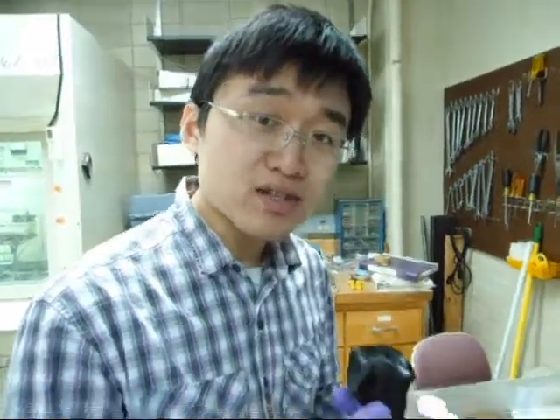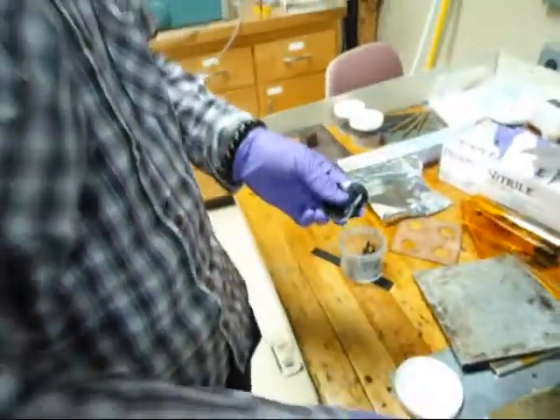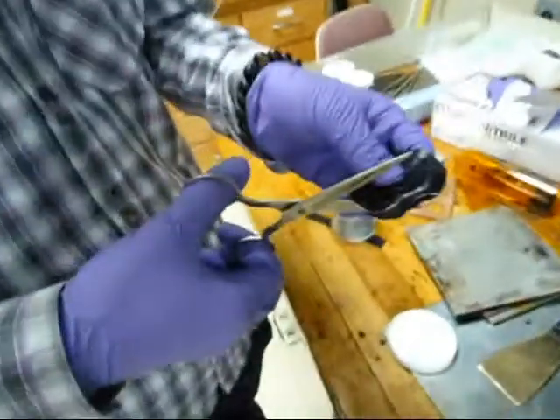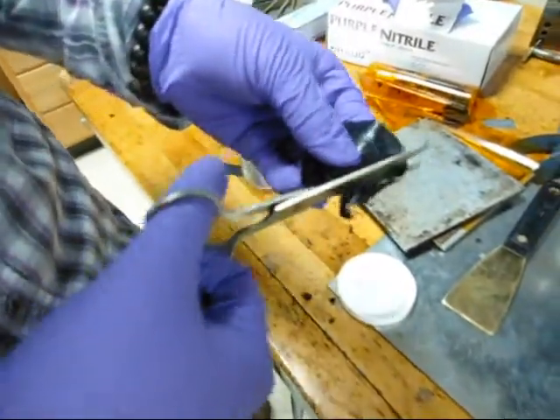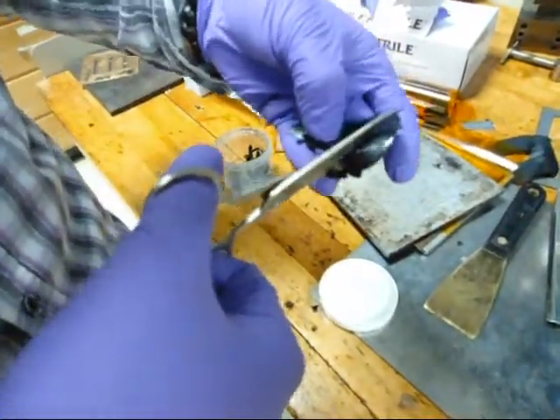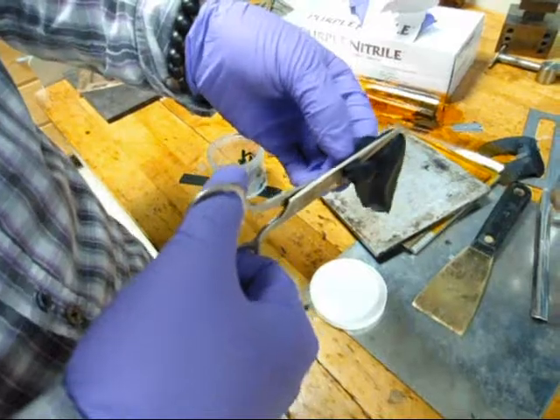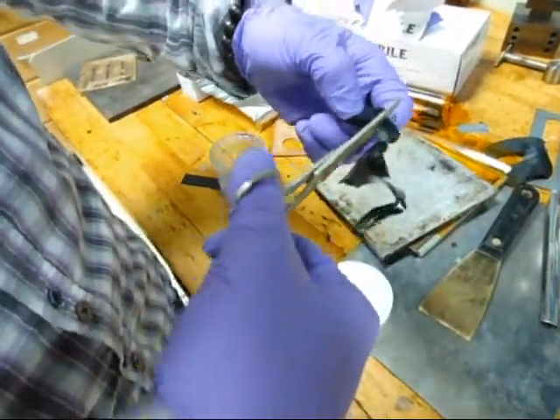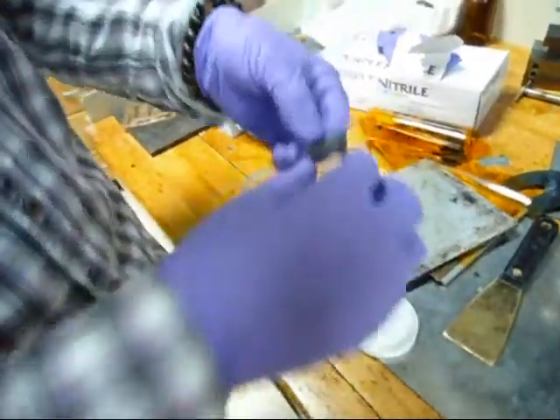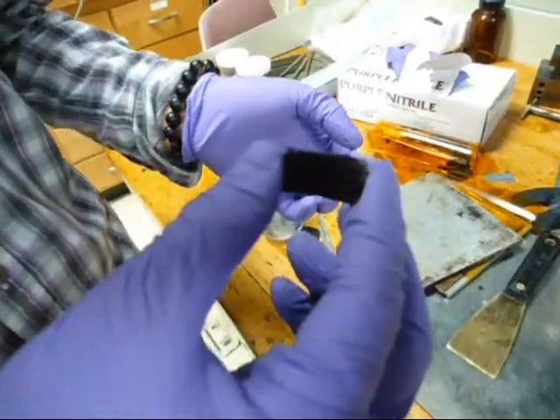After hot pressing, this is what we have got. Now, I am going to cut out the leftover. And this is the sample that we have got.